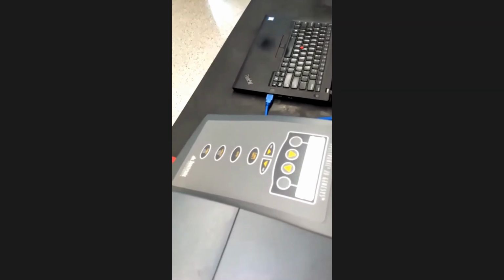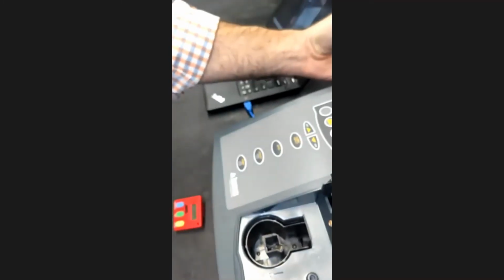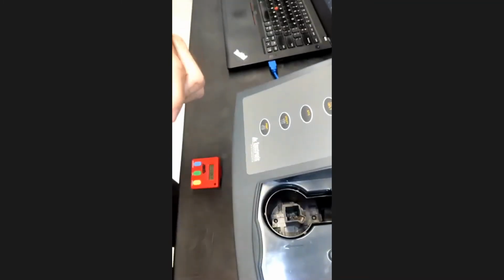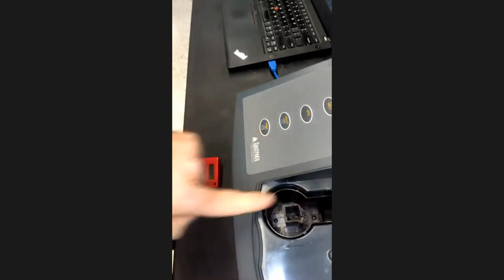I'll take you over here to the spectrophotometer now. Okay, this is the spectrophotometer. It should be set up. You can kind of see here, with 420 nanometers set as the wavelength for measuring absorbance. And then I am going to open up right here and try to give you a look inside the spectrophotometer here. There is a little place for me to slide my cuvette. The light shines front and back like this.